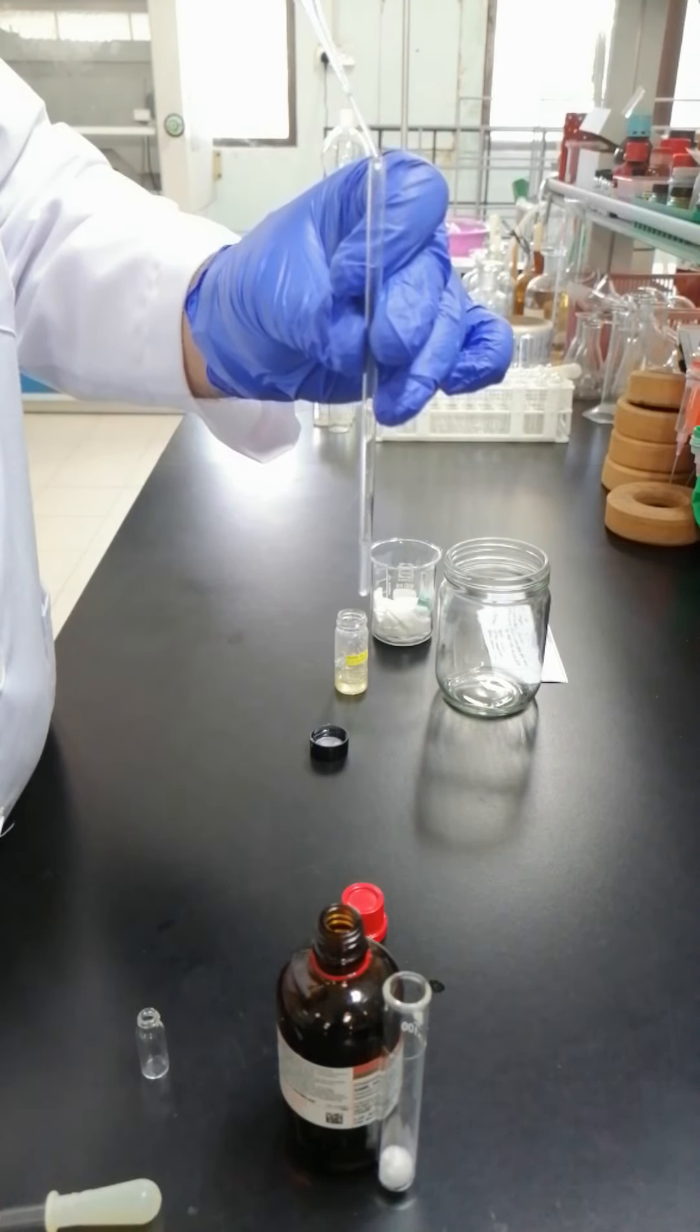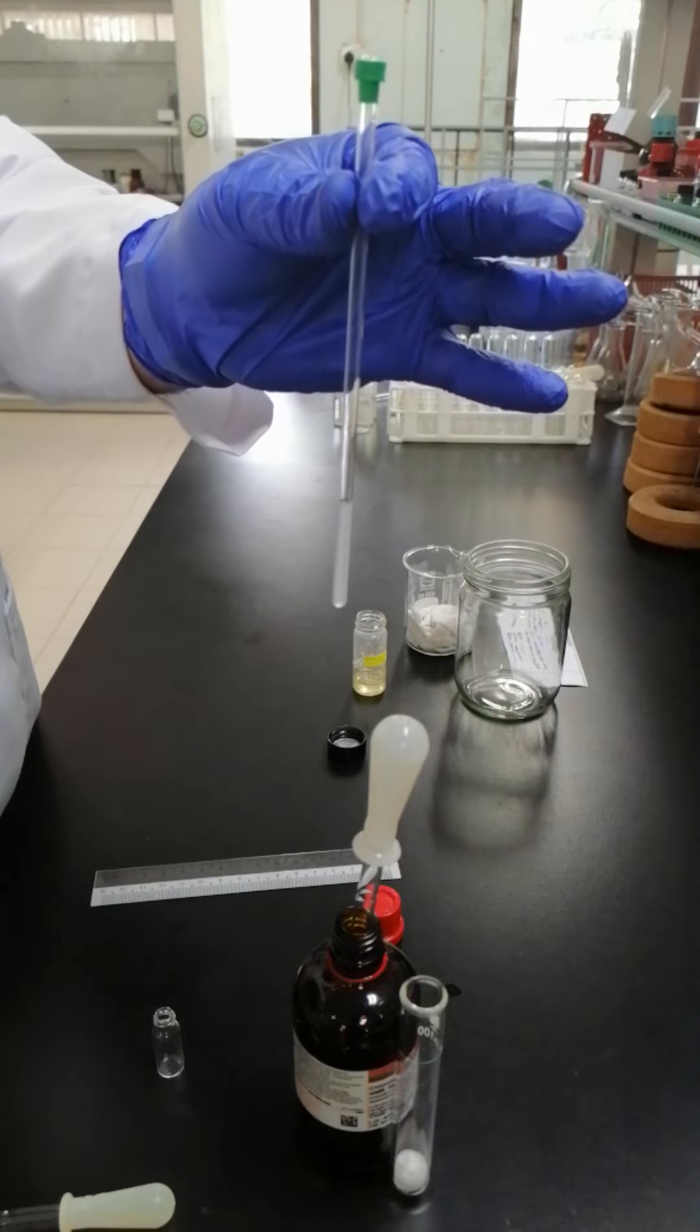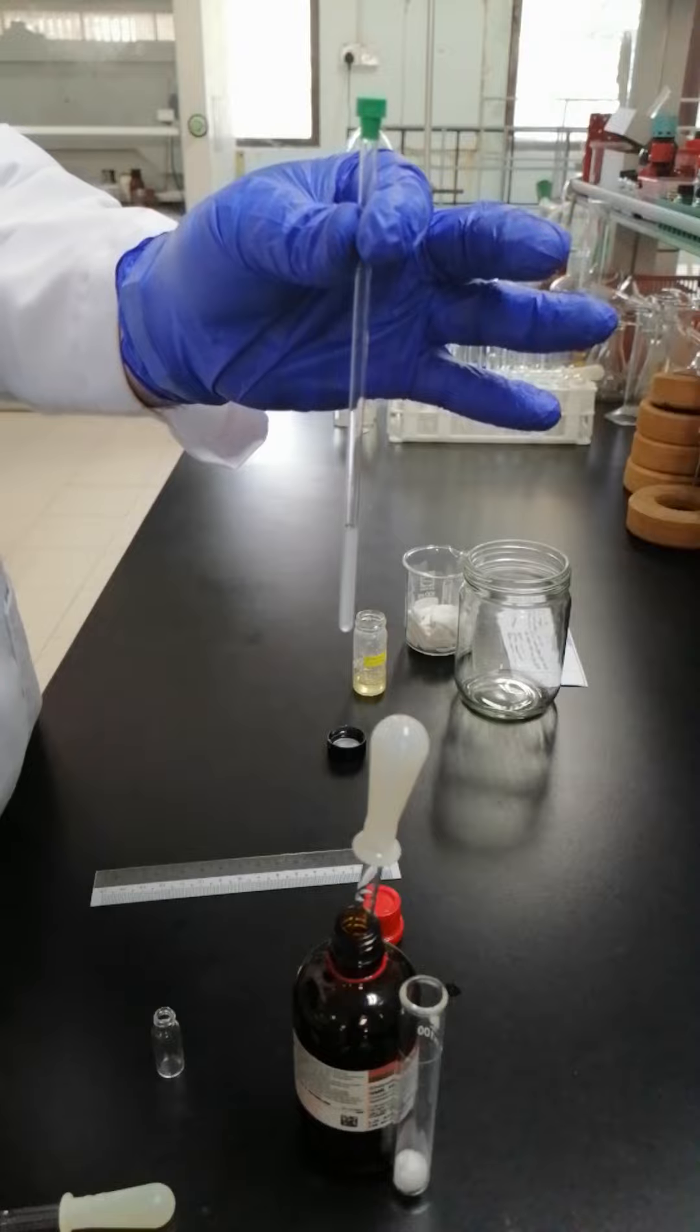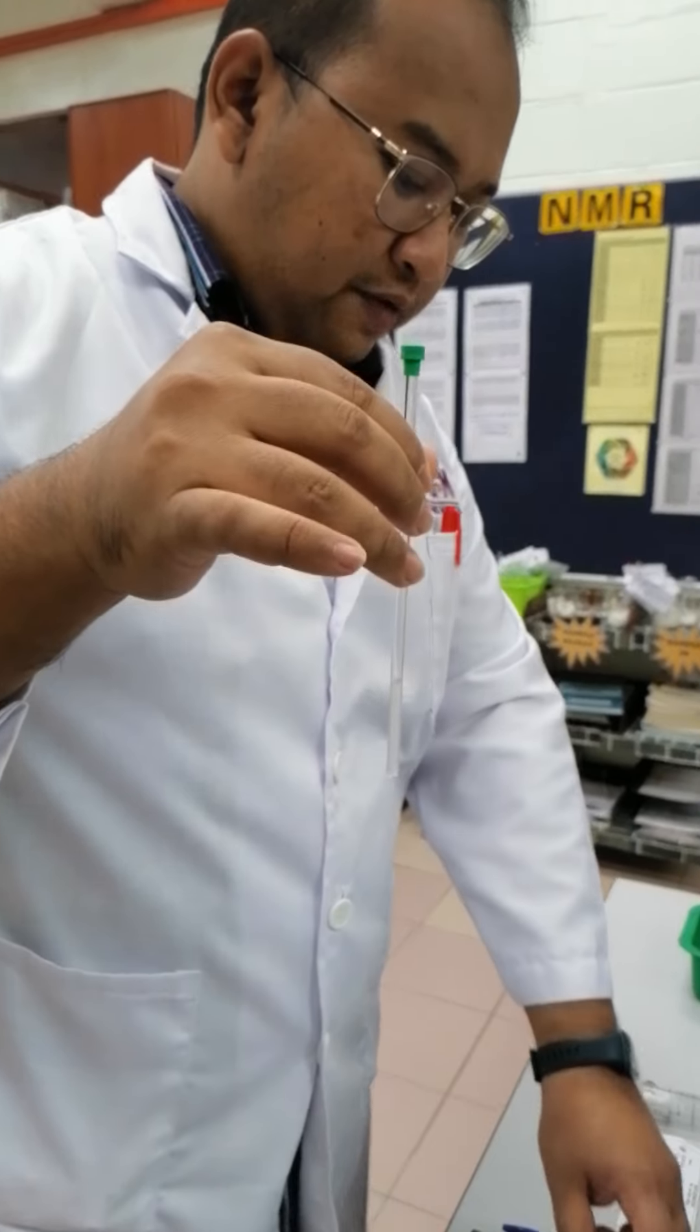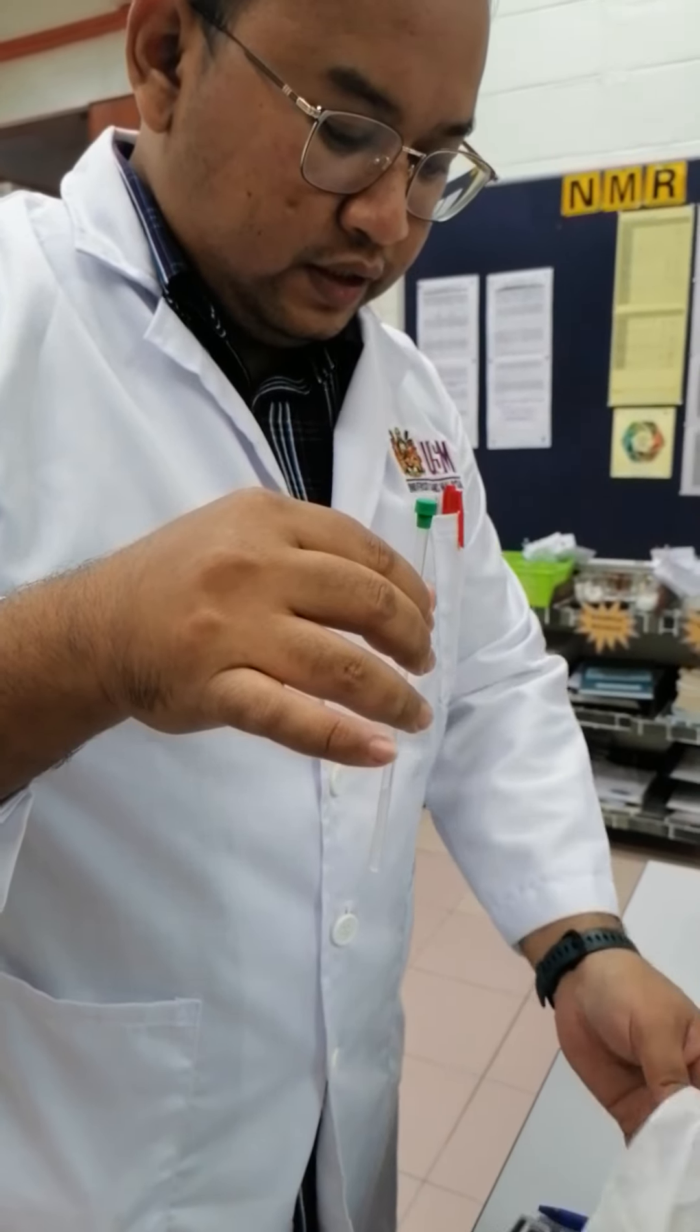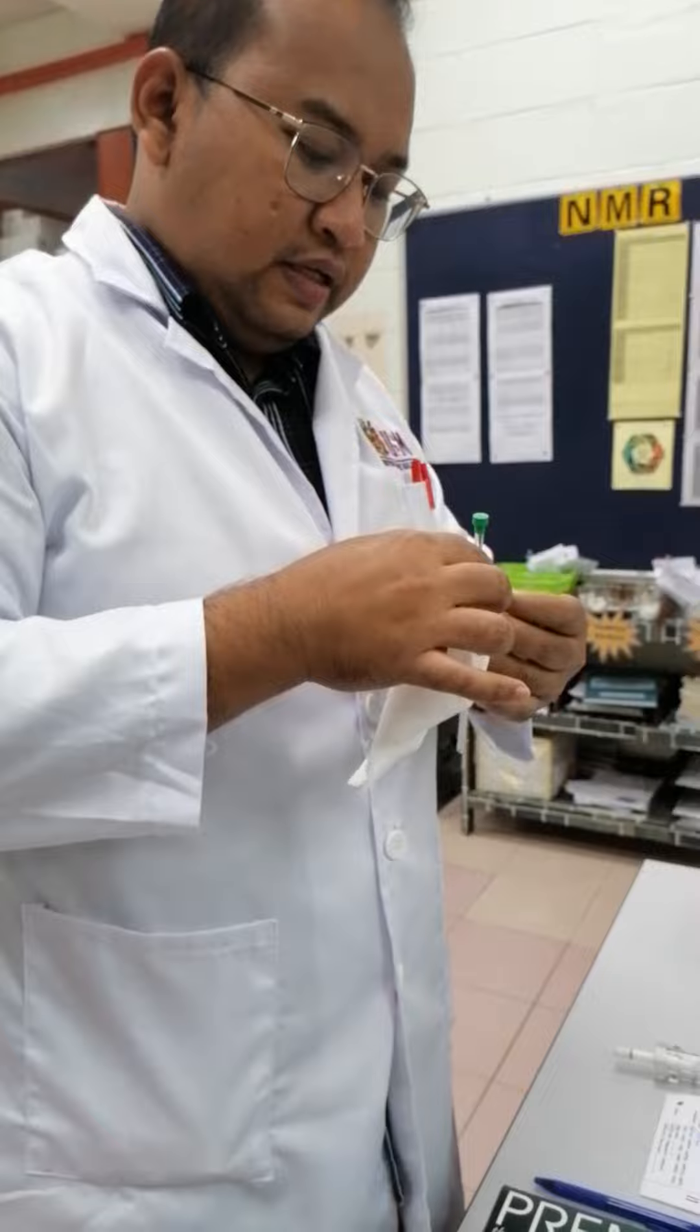Make sure you cap properly the sample tube. And this is what the sample looks like before we process it for analysis. This is the sample for NMR measurement. We have to wipe with the soft tissue first to remove the remaining oil, grease and fingerprint.